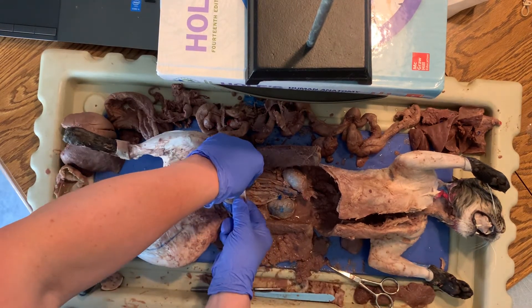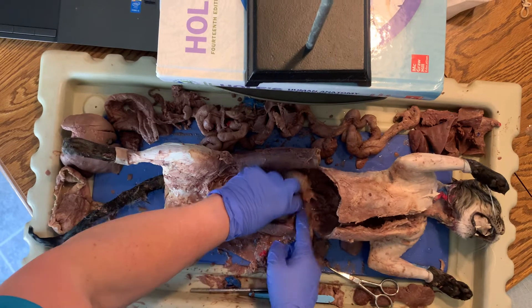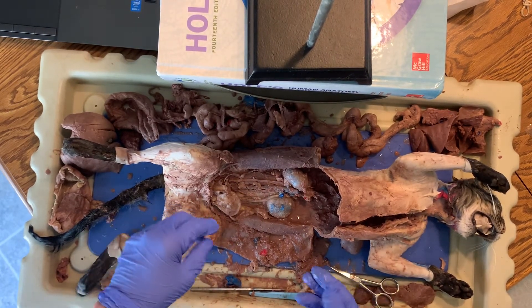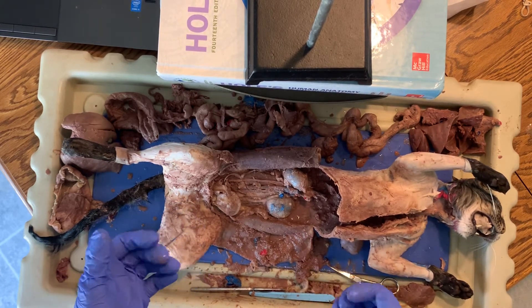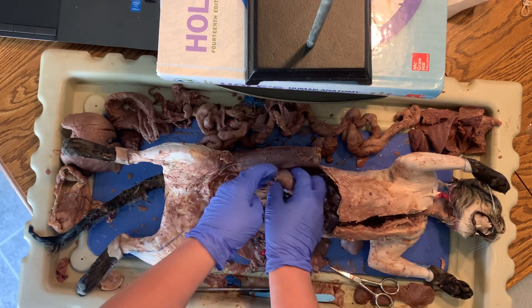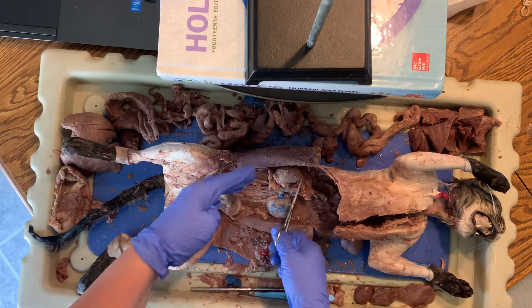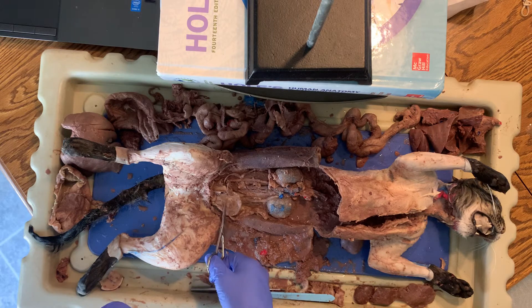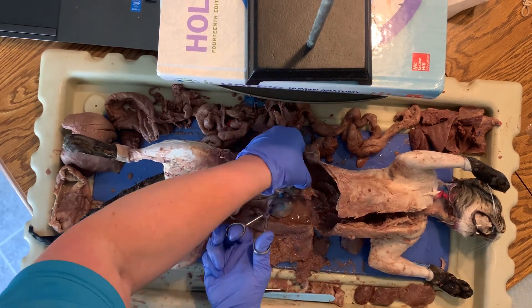That leads to the cat's bladder. These are stuck way down in the very back wall, and they call that being located retroperitoneal. So if you've ever heard of somebody giving somebody else a kidney punch — it's right along the back wall. If they punch you hard enough, they can injure your kidney, and it can cause you to bleed inside your kidney, which then sends blood down into the ureter, then into the bladder, and then you pee blood. That's how you know you may potentially have injured that kidney.